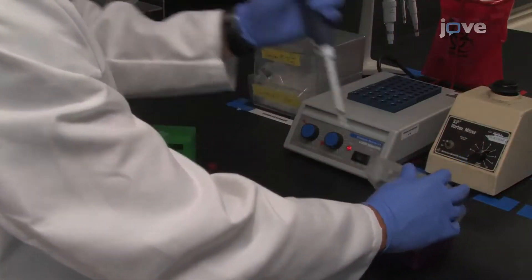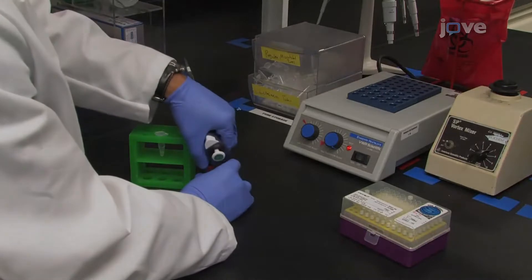After the protein concentration of the sample is assessed, prepare the sample for loading the gel.